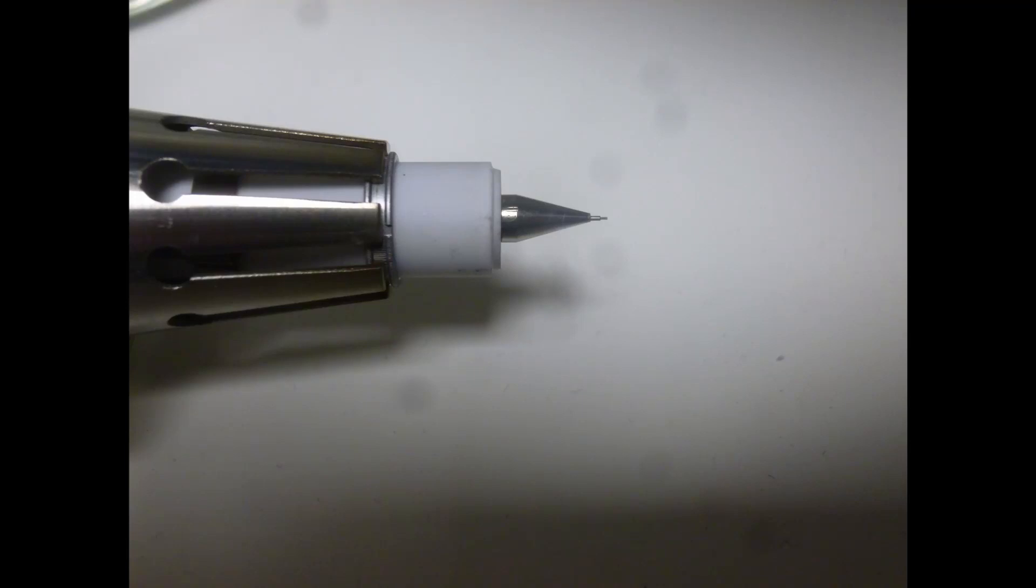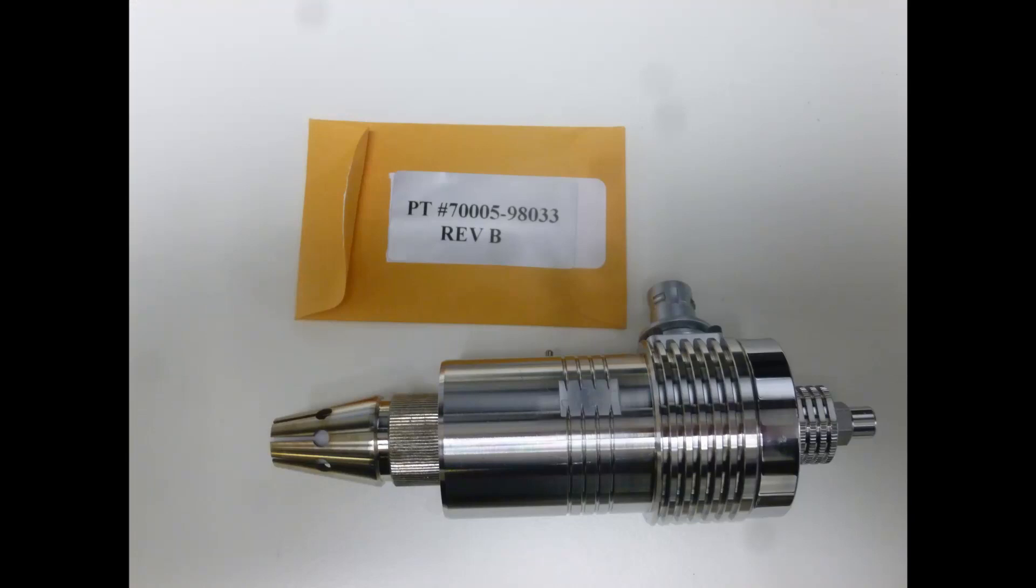Put the probe somewhere safe. Its fine end is extremely delicate. Next you will need to find the APCI probe and its needle which will be in a small envelope.